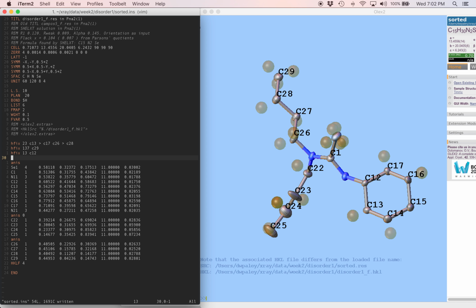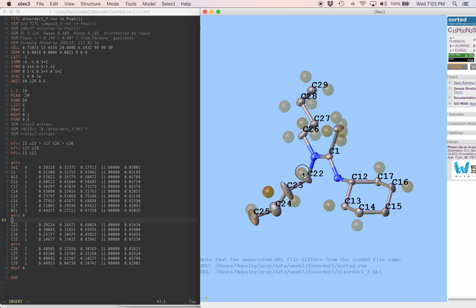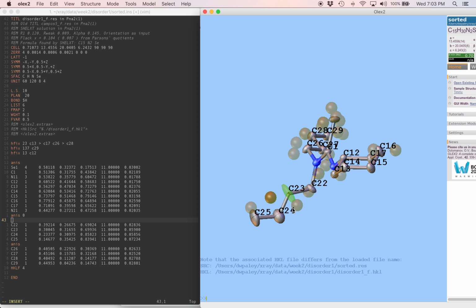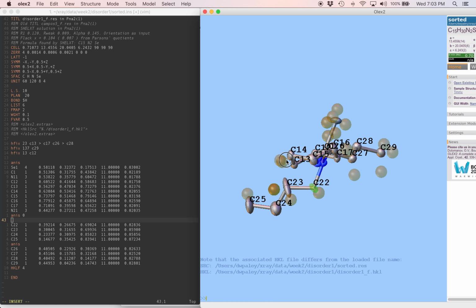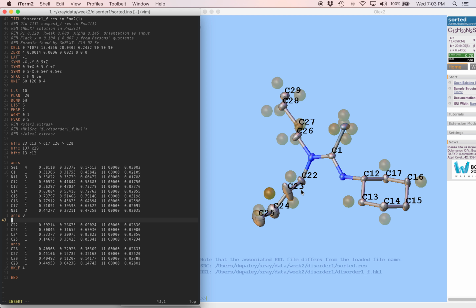Oh, yeah, and I forgot about the occupancy of the disordered part. You know, we're going to experiment with this two different ways. I can see that this atom is disordered. I can see that this atom has to be disordered too because I can see the two positions. If these two are, then the last one has to be. But the first one in the chain, is this disordered? It's kind of hard to tell, honestly. So let's start the disorder after C22, and we'll see what happens then. And as long as we're doing that, for now we'll leave C22 anisotropic.